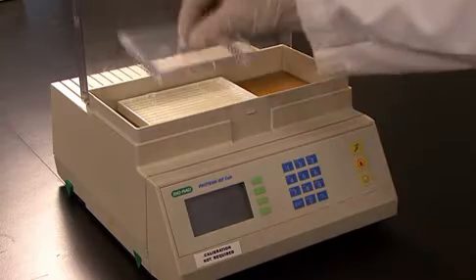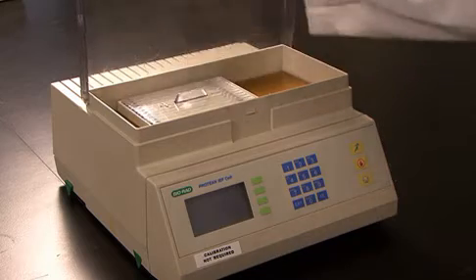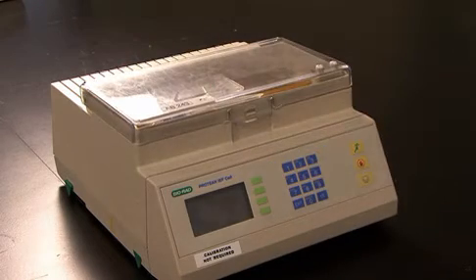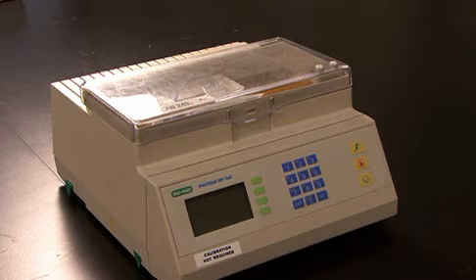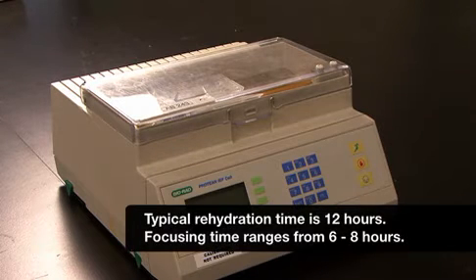Now I am going to program the protein IEF cell. Instructions for programming are provided in the protein IEF cell manual. Typical rehydration times are 12 hours and focusing time ranges from 6 to 8 hours.